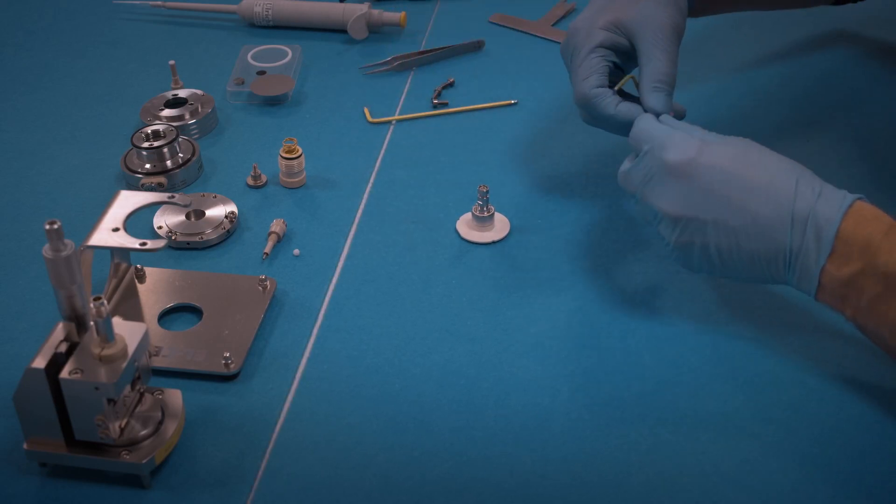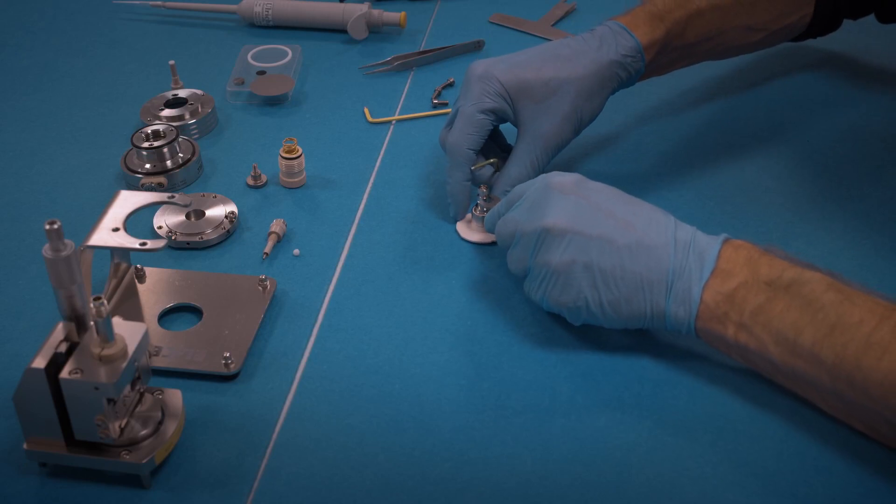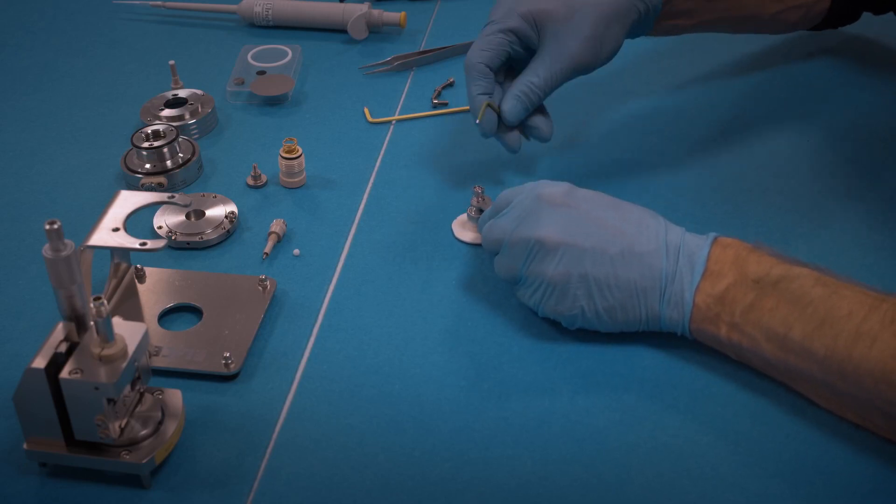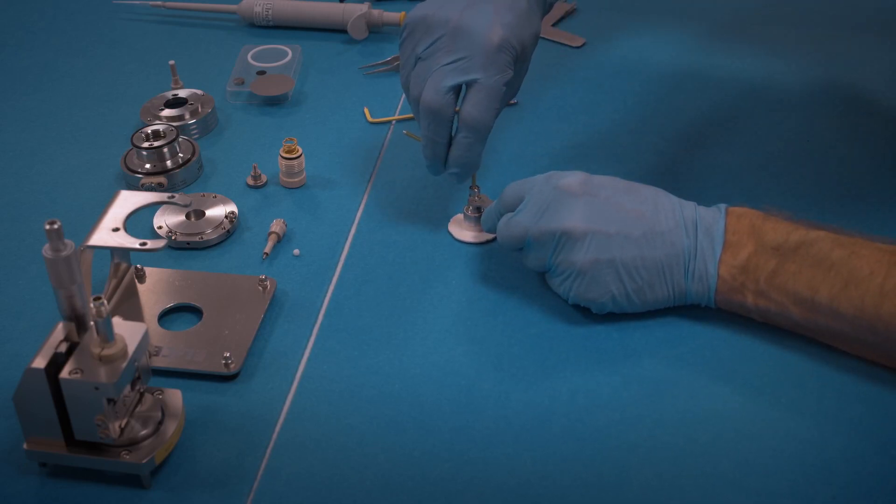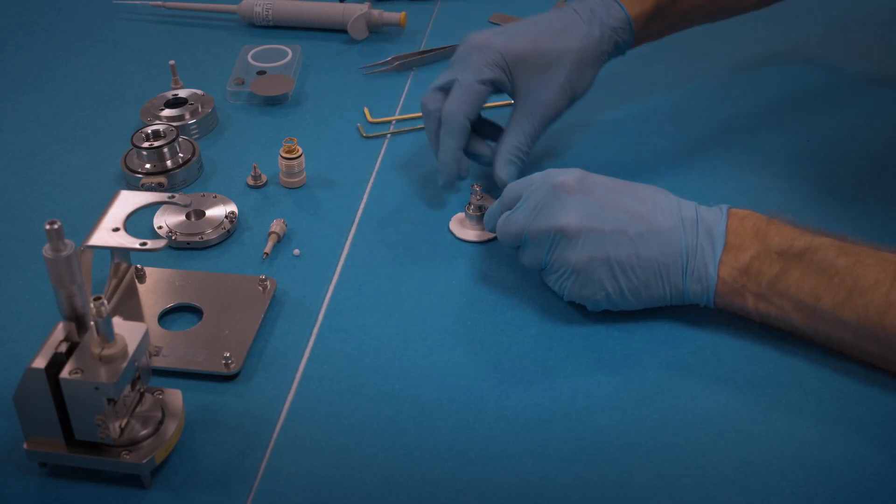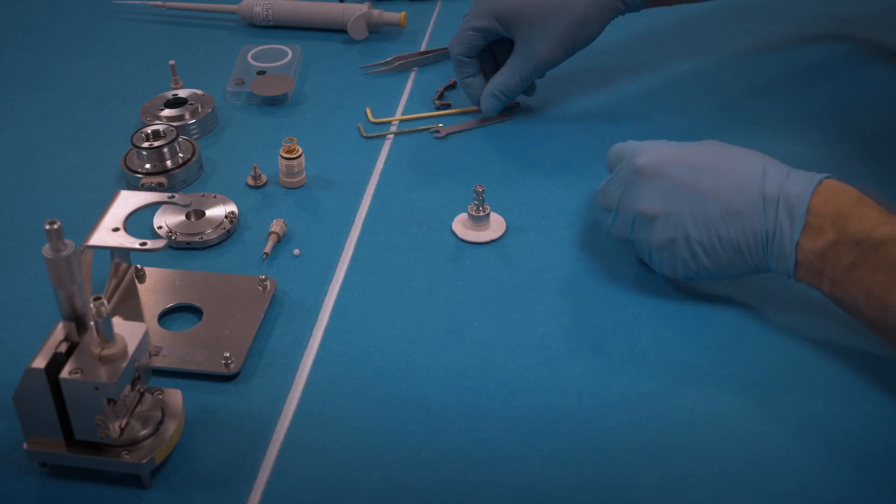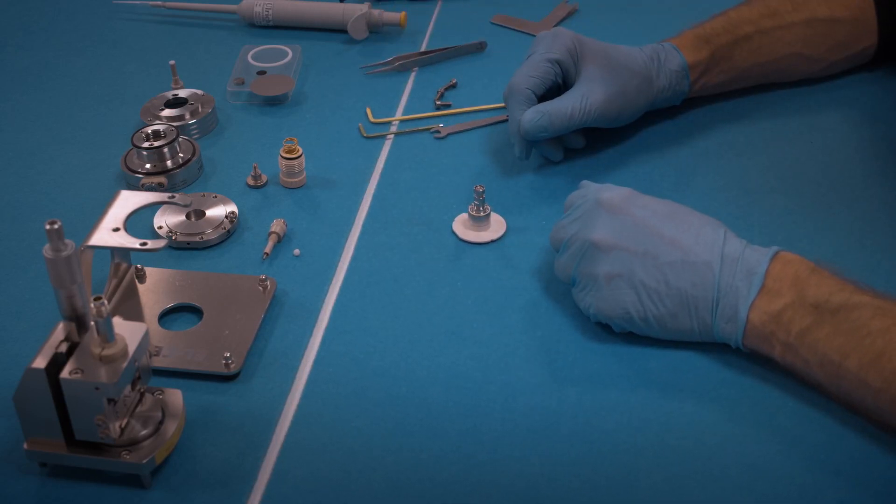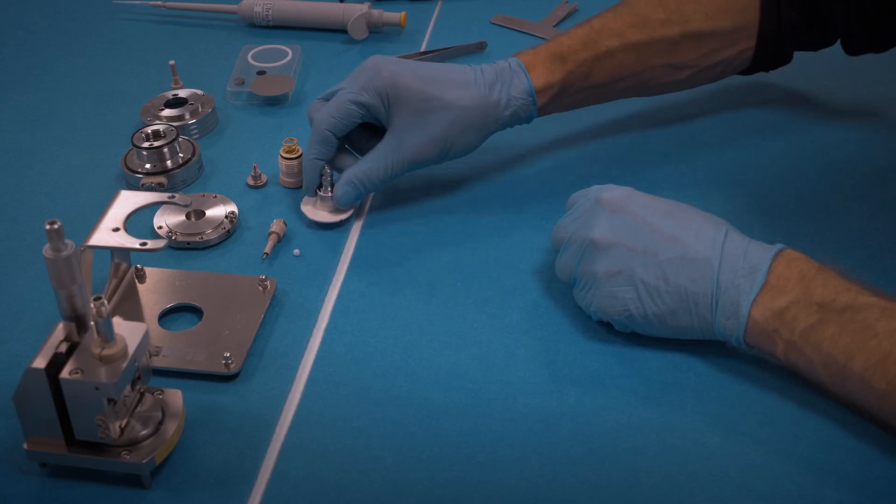Use this seven millimeter wrench to prevent the piston from turning while you tighten the screw. You have to apply significant force here in order to tighten the piston against the frit flange.